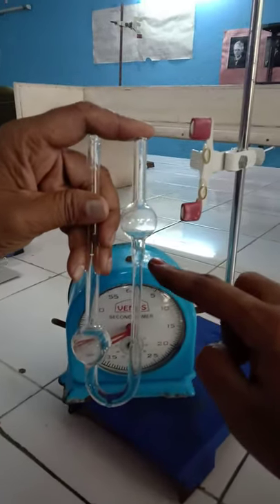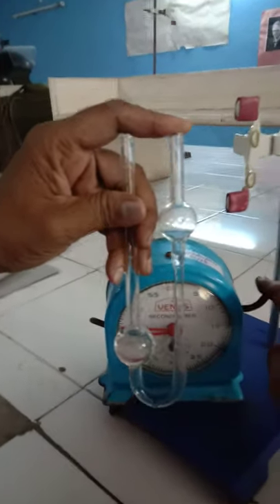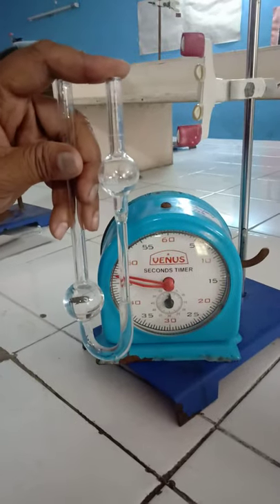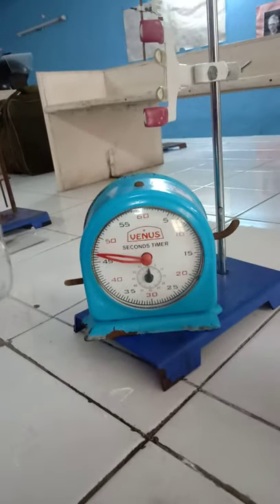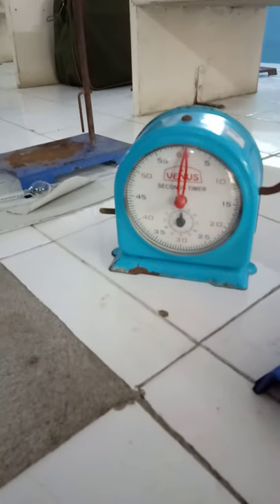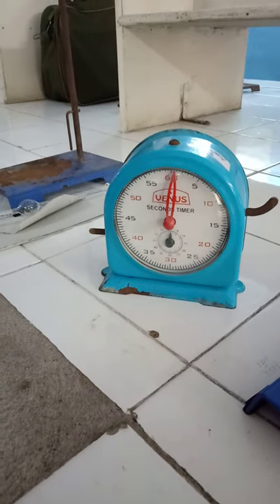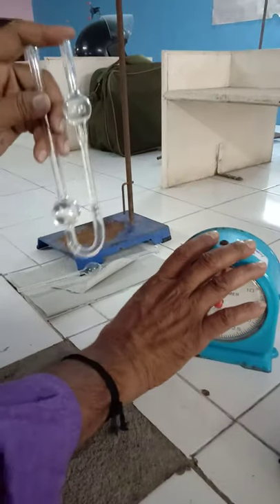Whenever water reaches the lower mark, we should stop the stopwatch and measure the time in seconds. The time observed is 2 minutes, which is 120 seconds. Repeat the same procedure with water and note the time. In the next step, we need to take the given liquid, which is ethyl alcohol, in the Ostwald viscometer.